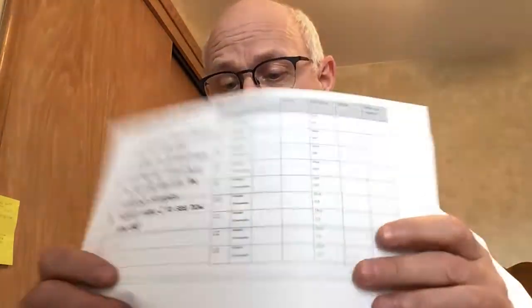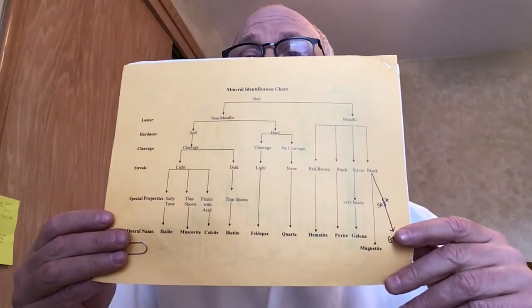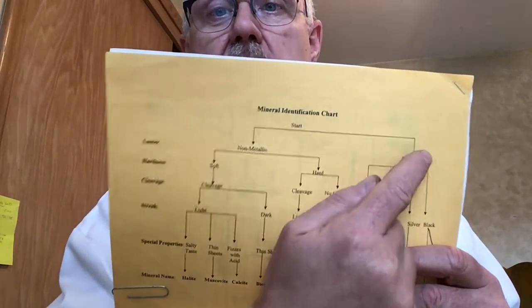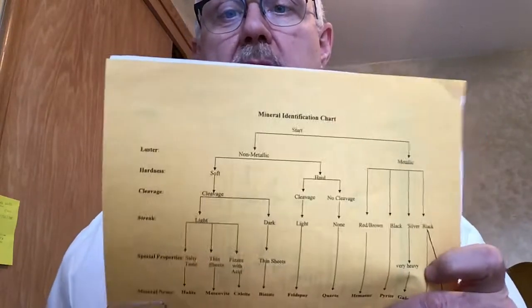In addition to that, after you test that, you'll notice that the link that says right here, click here, will give you this flow chart. And after we're done testing the minerals, you're going to go through the flow chart and try to figure out what they are. This is really a yes or no situation. So yes or no, is it non-metallic or is it metallic? So you either go to metallic if it has metallic luster or this way, and then you just problem solve from there. We'll go through that at the end as well though. All right, on video number 2. All right, so let's get to testing.